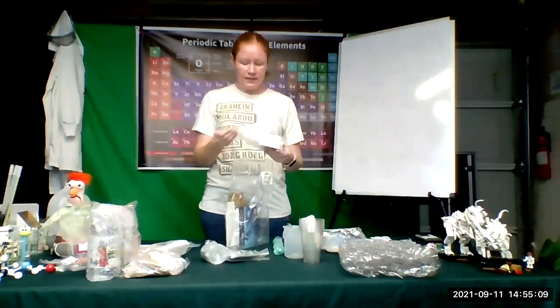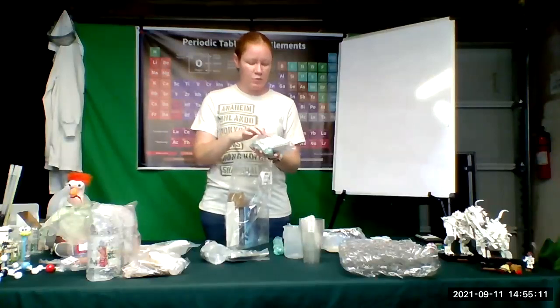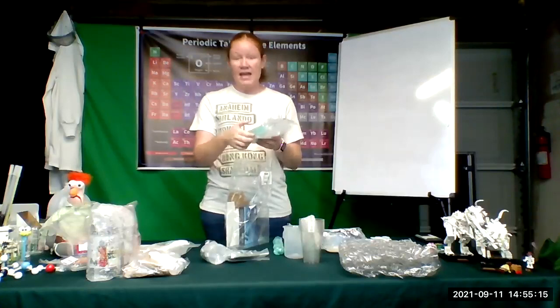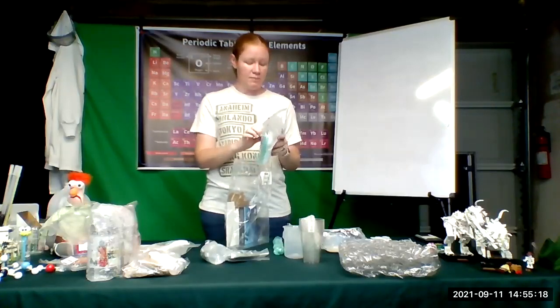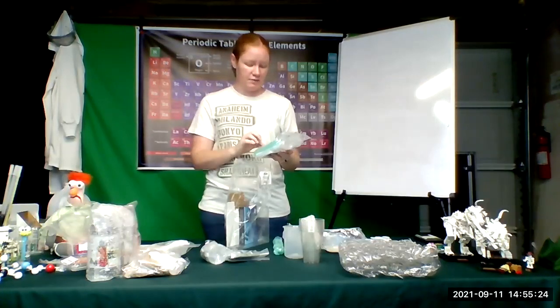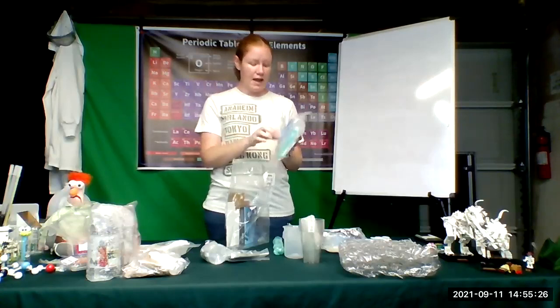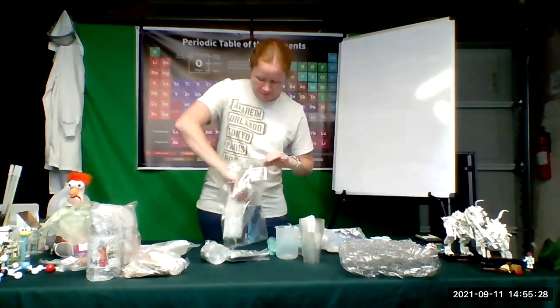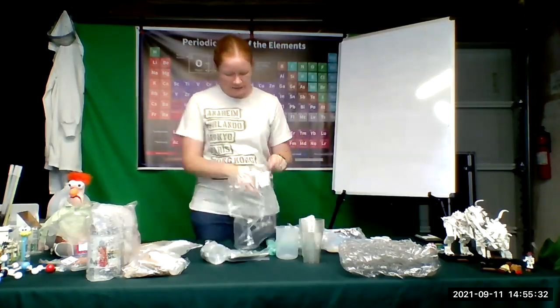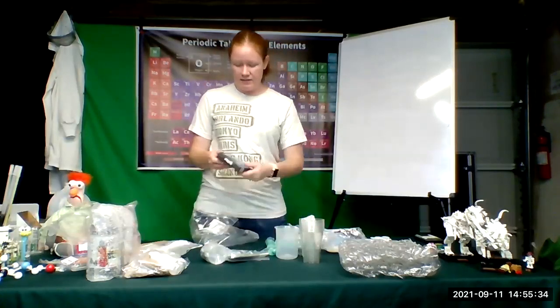Wrapped in this bubble wrap is a glass Erlenmeyer flask. Okay. In this little packet, we've got some weigh boats, a candle, some smaller cups, some spoons, a glass test tube, a bunch of pipettes, some plastic test tubes, a grease pencil for writing on your test tubes and other stuff with, and a ruler and a pair of tweezers. Okay, here is what is known as your test tube rack. And then here is your digital scale.